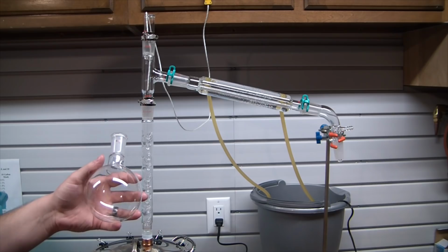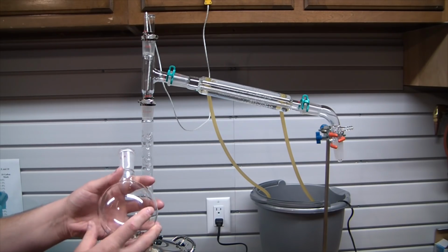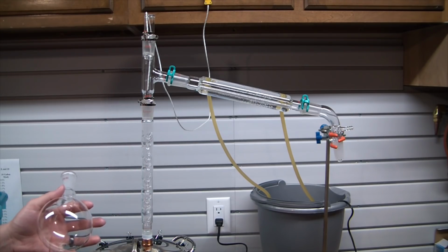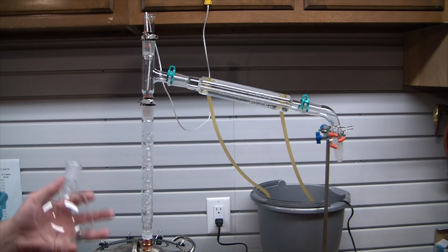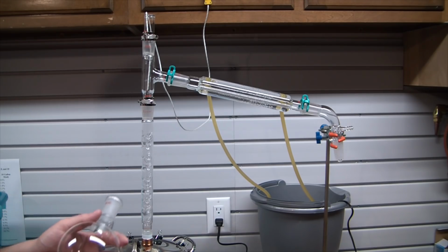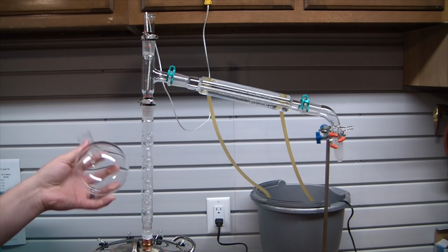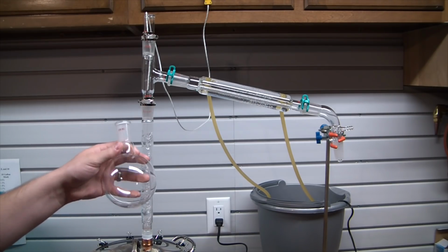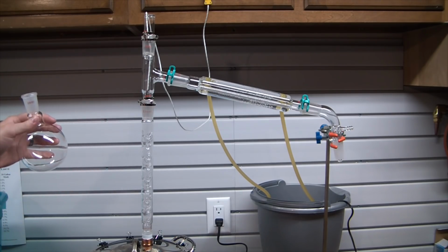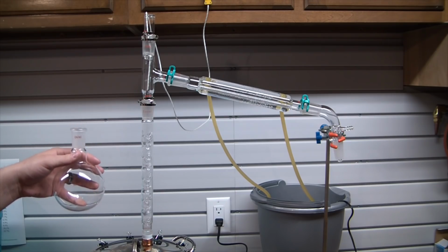You can trust them. The generic no-name Chinese stuff, though, in this case, I'm trusting it with ethanol, which isn't a very dangerous organic vapor, as long as you kind of know what you're doing. I would not trust this for distilling mercury or something of that nature. It is not that level of good manufacturing practice you want with something like this. So, just a note for you guys there. While I'm using it here, I don't recommend it from a safety standpoint.